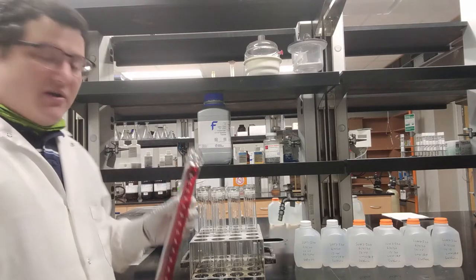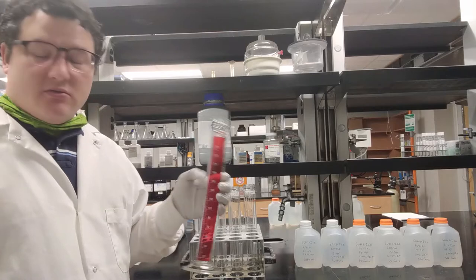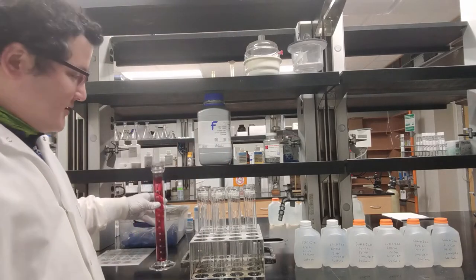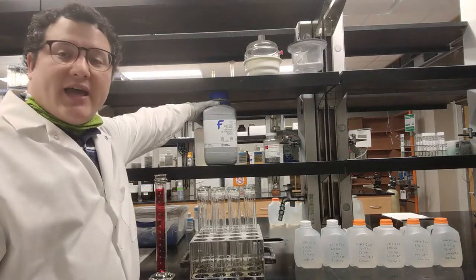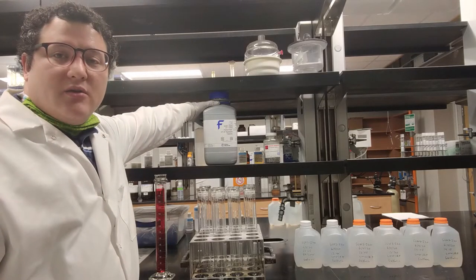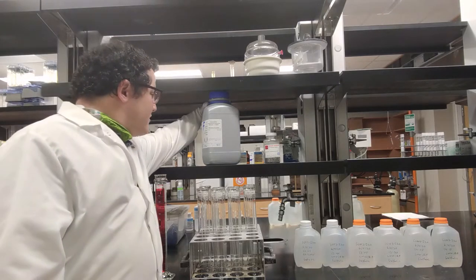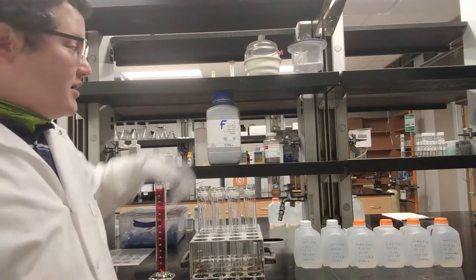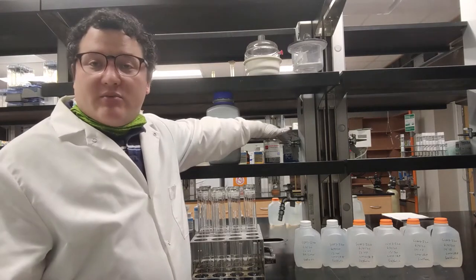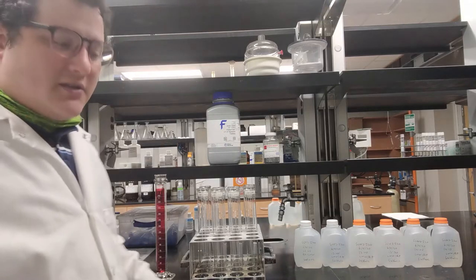Additionally, I have my 250 milliliter graduated cylinder. I'm going to use this to measure 250 milliliters of each water sample into the vessels. And then I have my Kjeldahl tablets. These are mostly copper sulfate and potassium sulfate — copper sulfate is the active ingredient. And then boiling chips to ensure a smooth boil that is not violent.